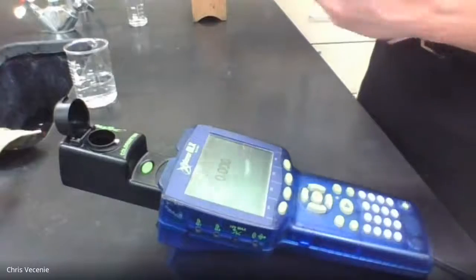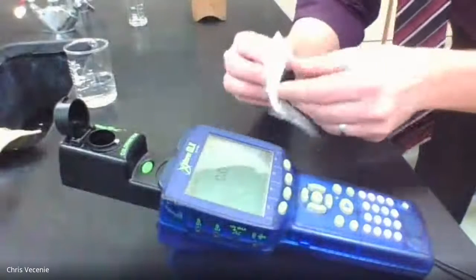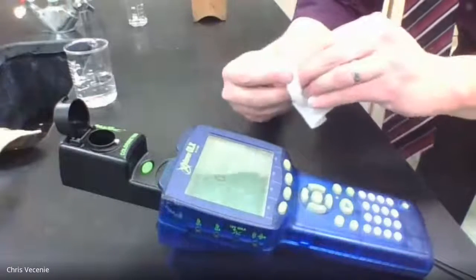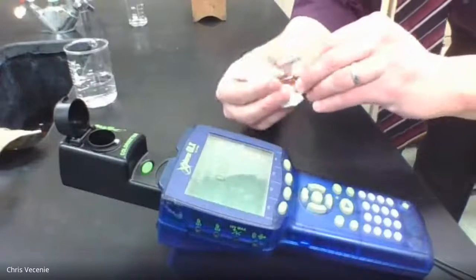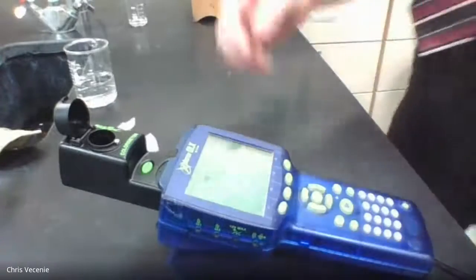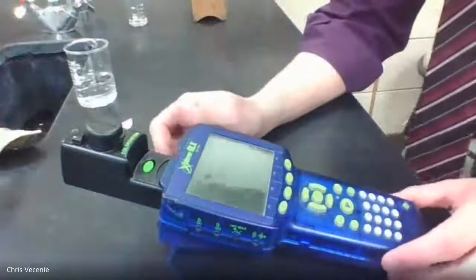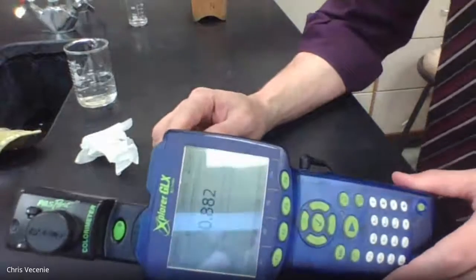All right, now I cap this thing, and then everyone had a tissue. All right, wipe it, and the whole idea was I want to wipe off my cuvette because I don't want any fingerprints to be blocking the light, because what we're measuring with this is how much light gets blocked. So I want all the light being blocked to be due to the blood reddish color of the liquid that's inside there. Okay, so now I'm going to put this thing in here. All right, and we're going to go ahead and get ourselves an absorbance. All right, so if we do that, original reading for your first table there, you're looking at 0.882.